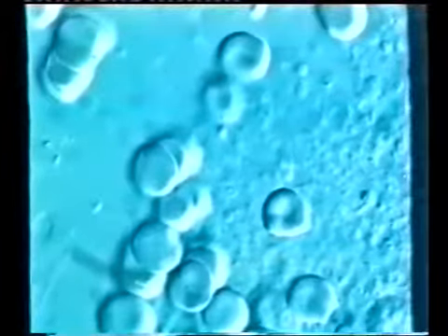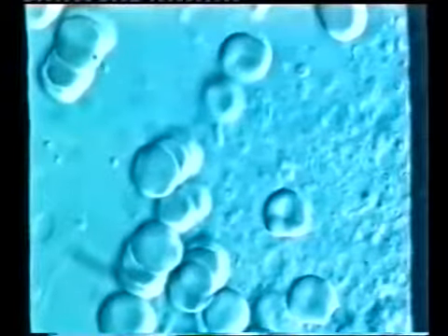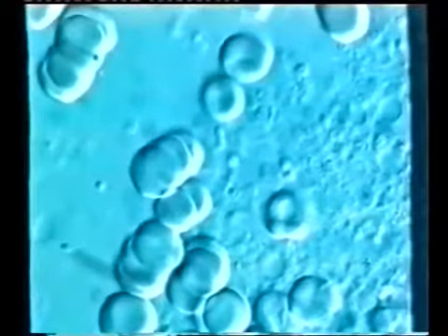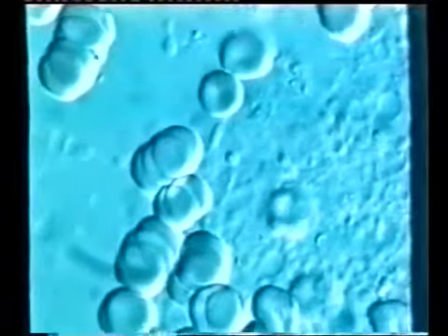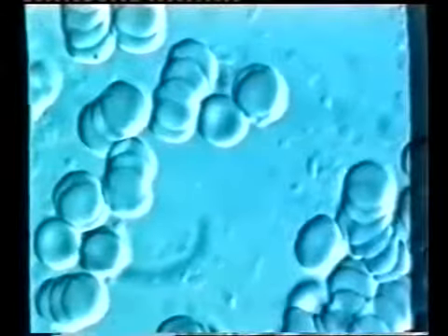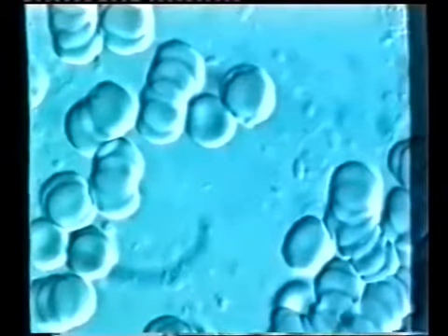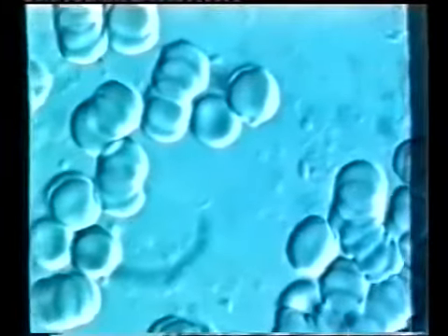Now I will follow the light peripheral zone around this structure in the microscope to show all the mysterious moving particles in this area. It seems as if those particles keep to the central part of this structure, and they don't seem to mix plentifully with the surrounding red blood cells. Here, for example, there are only a small number of them among the red blood cells, and suddenly there are no particles at all to be seen, and far away from this structure the blood can look almost sterile.